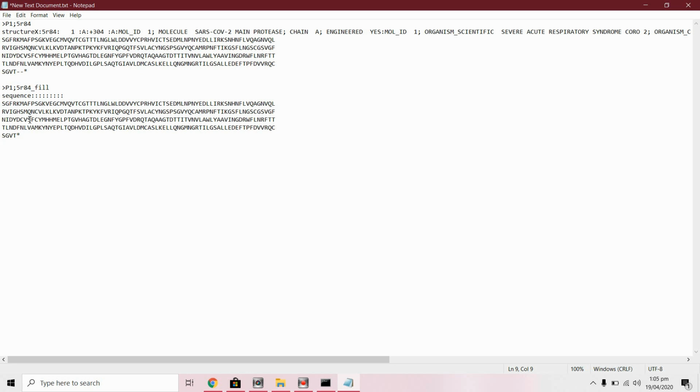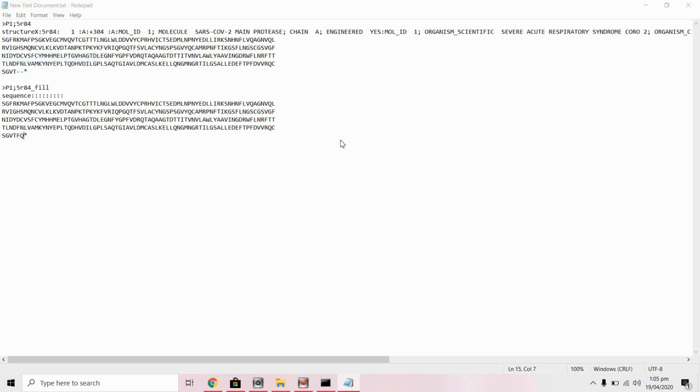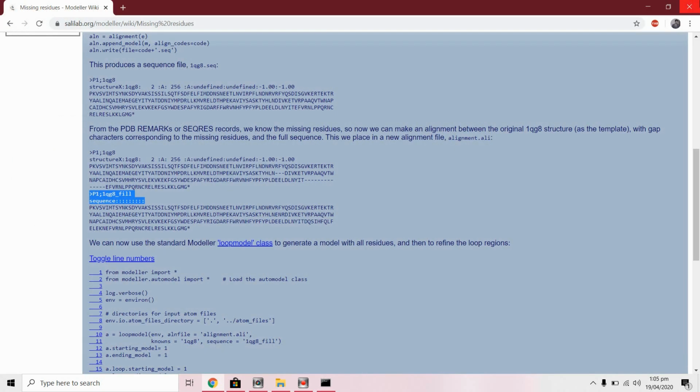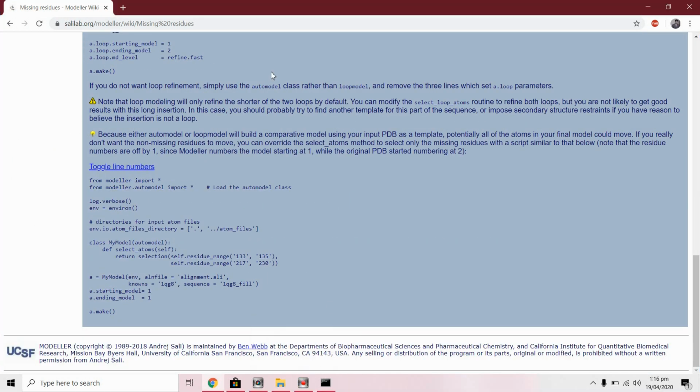Now what we will do, we will add those residues in this sequence. This is the original structure with gap characters according to the missing residues, and this is the full sequence. Those residues were phenylalanine and glutamine. So for phenylalanine F and for glutamine Q. Okay, now save this alignment with .ali extension. We have prepared the alignment file.